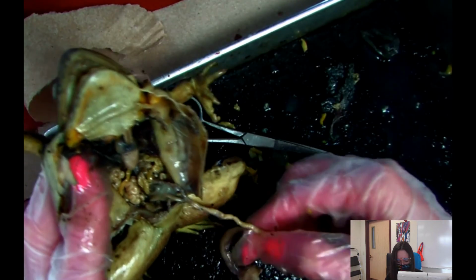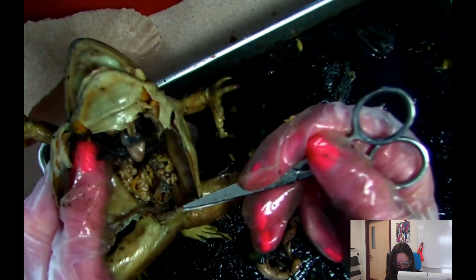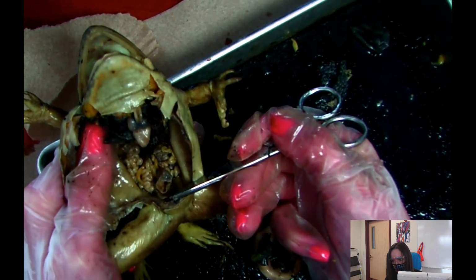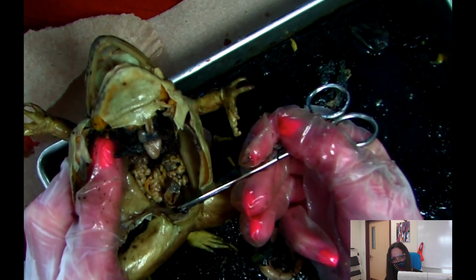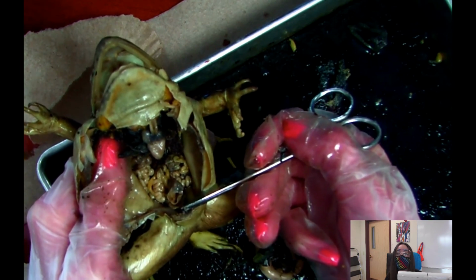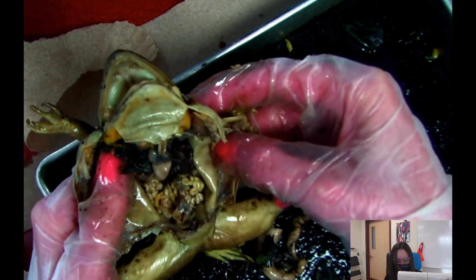That's kind of gross. It's kind of like sticking out right here. I know this is kind of a gross video. And then there's this clear structure at the bottom, and you can barely see it. And we're not going to quiz you on it just because it's so hard to see. It's the bladder, and so it's this really super thin, clear structure at the bottom, and that would be the bladder.